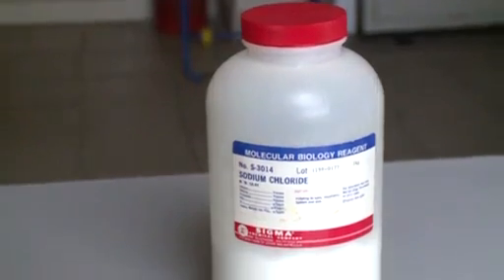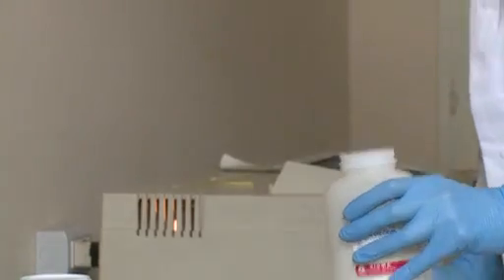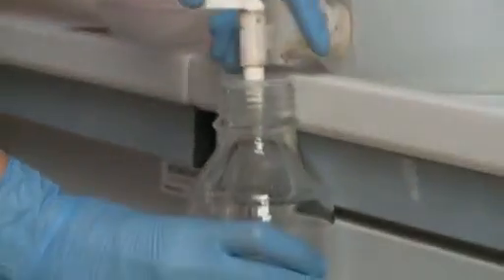In this trial we use two percent sodium chloride sterile solution as exposure medium. Sterilized synthetic or natural seawater can also be used.